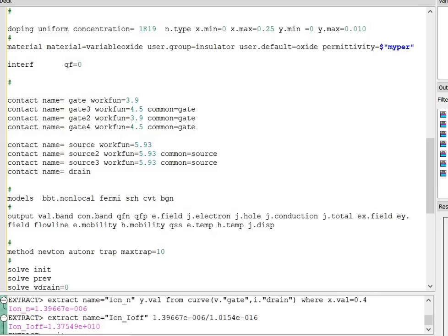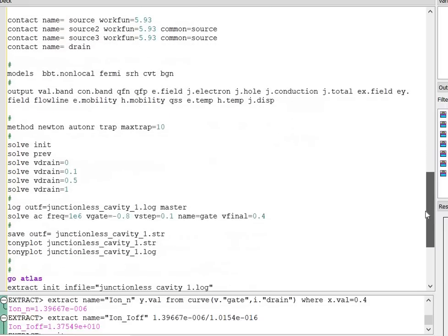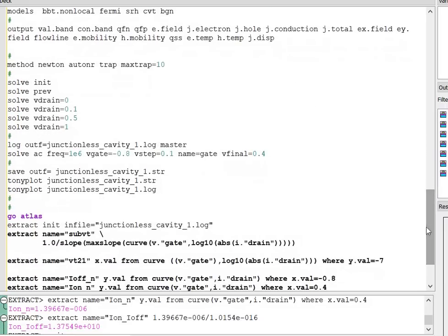Next, I will define the model statement. Next, I will define the output valence band. This is useful to find out the different valence band, conduction band, surface potential from the model file. Next, I will define the different voltage at the drain end, source end and the gate end after the method statement. After that, we have saved the structure file and the log file. By using the Tonyplot statement, you can view the structure file and the log file.